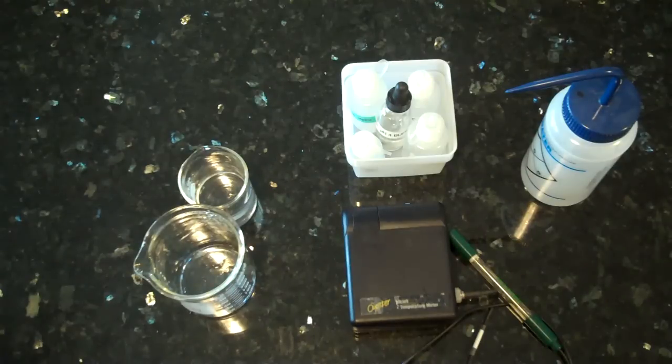In this segment I'll be demonstrating how to use a pH meter. A pH meter reads the pH of a solution, the pH being the negative log of the hydrogen ion concentration in that solution.